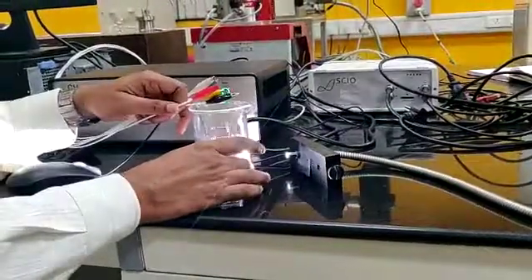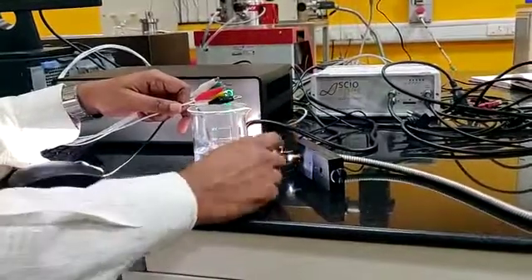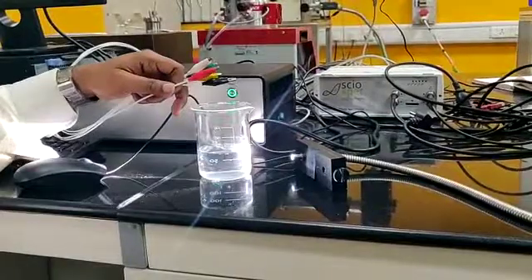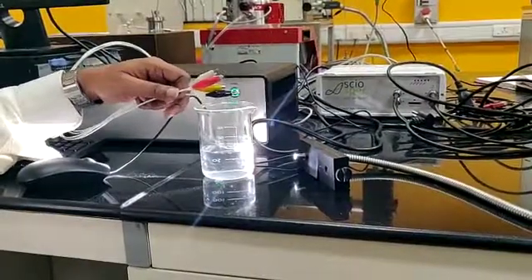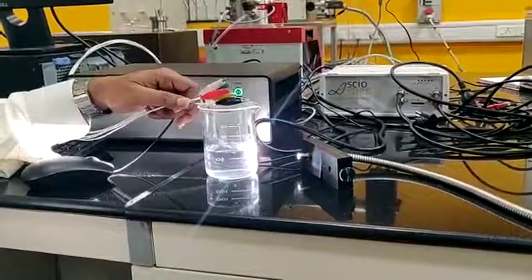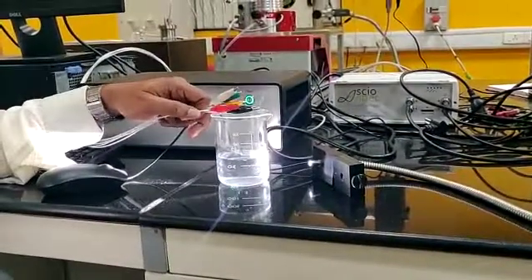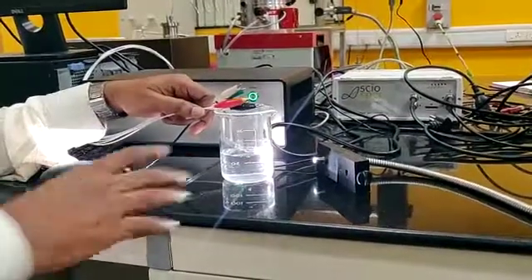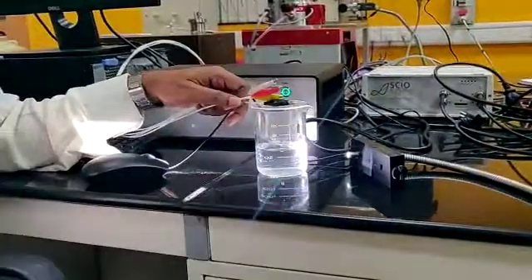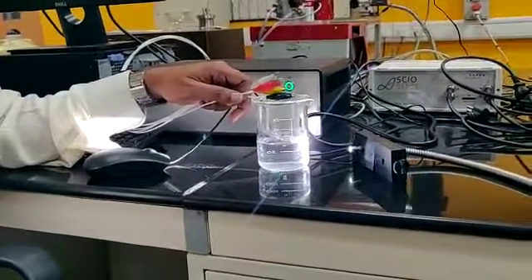For a wavelength response system, it will pass through a monochromator. The monochromator light will fall on the sample. There is a setting to choose the wavelength through which we can do the wavelength response measurements. When it is white light, you can do photo-electrochemistry, and when you have a monochromator in between, one can do wavelength response measurements.